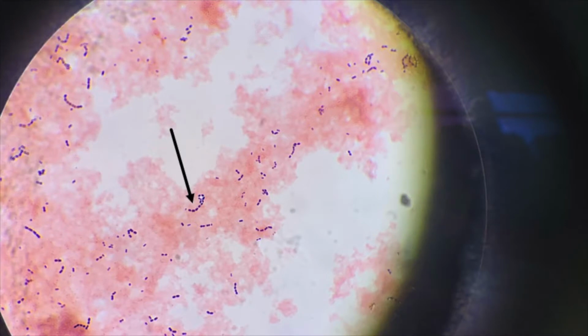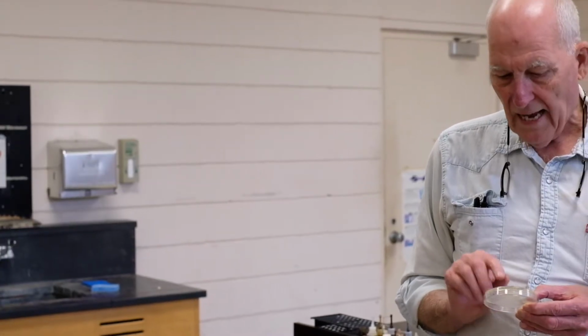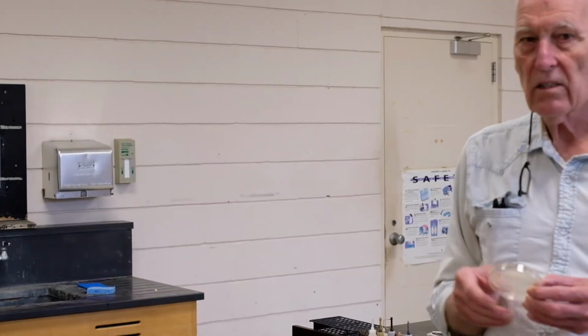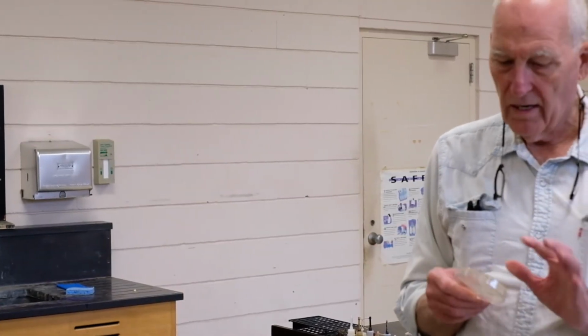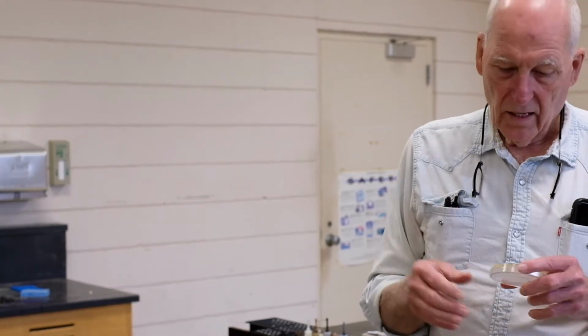Well, in this case, the Leuconostoc, we're going to show you a picture of it in a minute, is still around after 7 days, and we kind of thought about it. But what happened this time is we're incubating it in an incubator and controlling the temperature. We incubated sauerkraut at 18 degrees centigrade. All the years before that, we did it at room temperature, which is 22 degrees.